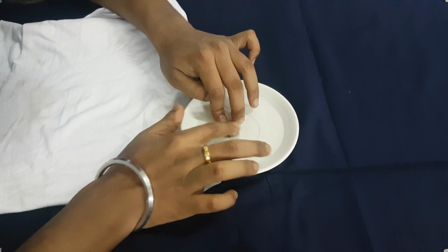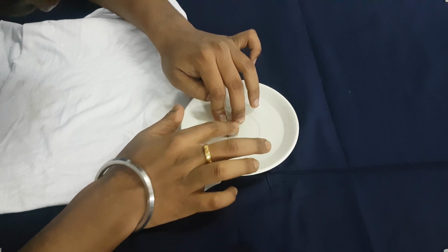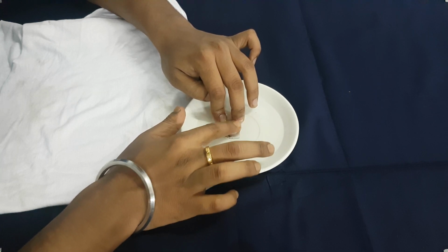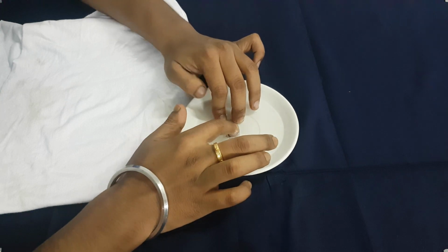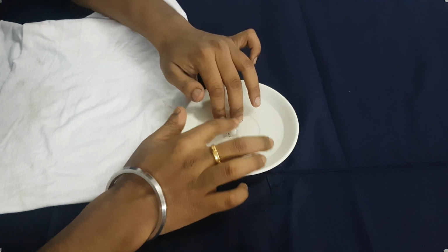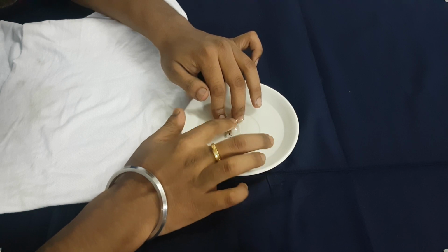Very little soluble, but I don't think that it will be soluble like that. I think it will be like water and silicone sealant, like what we did previously with sample number 1. I did not talk about it that much. Oh yes, we talked. It was making a bit of sound. I did last night, yesterday. Yeah, it was making a nice sound.